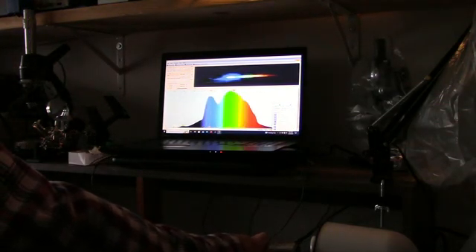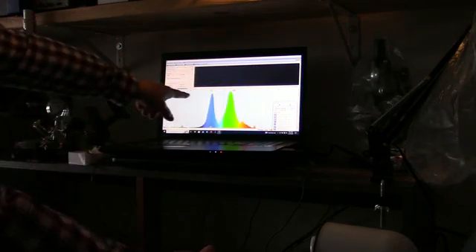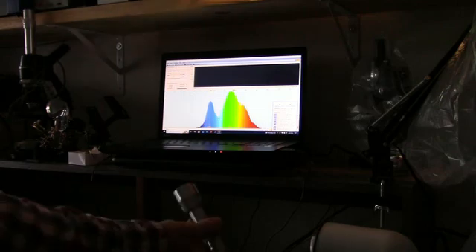Here's a white LED flashlight, shining it in the slit here. On the top, you can see what the camera is seeing, looking through the slit in the spectrometer, and this shows the spectral lines. Of course, positioning this is a little delicate. I should mount this on a support, and then I could adjust it for maximum. But anyway, you can see there is quite a bit in the shorter wavelength. Here we go, 500, and that big peak there is about 540 nanometers. There's another peak lower at about 450 nanometers, and another peak up near 600, just below 600. That's using an LED flashlight.